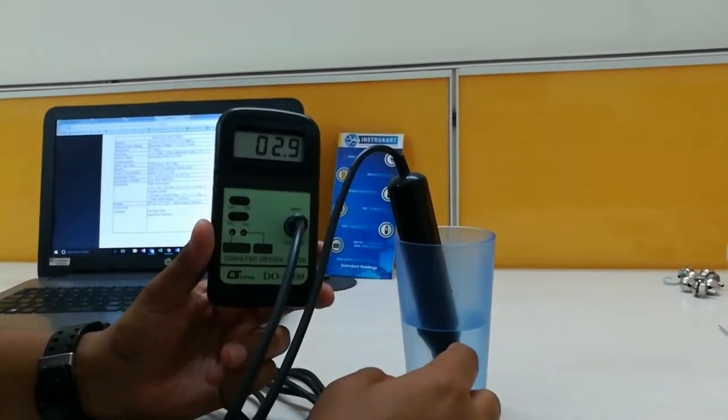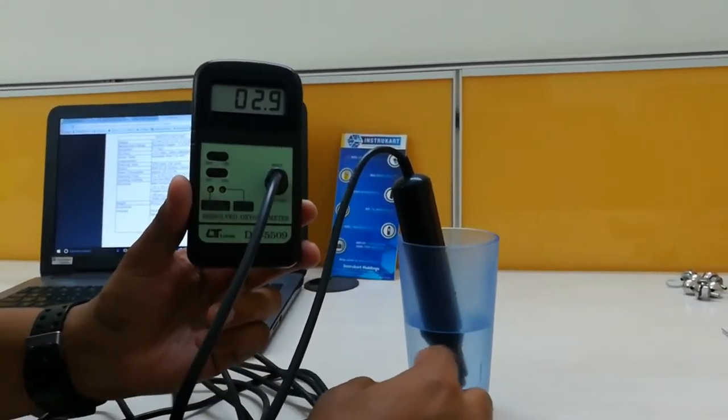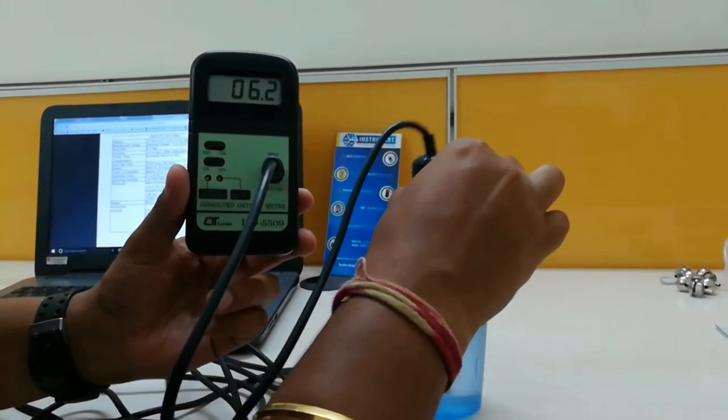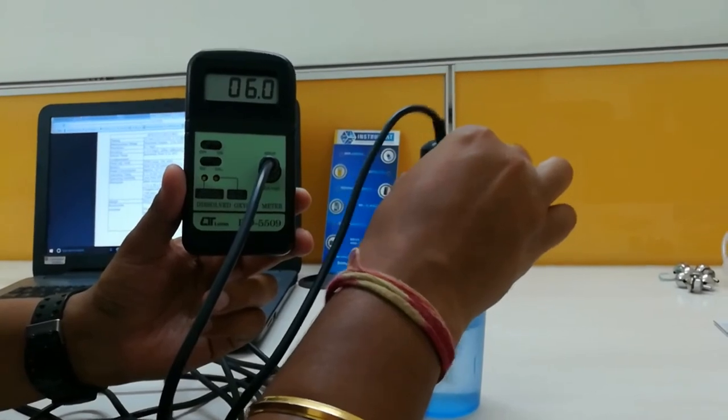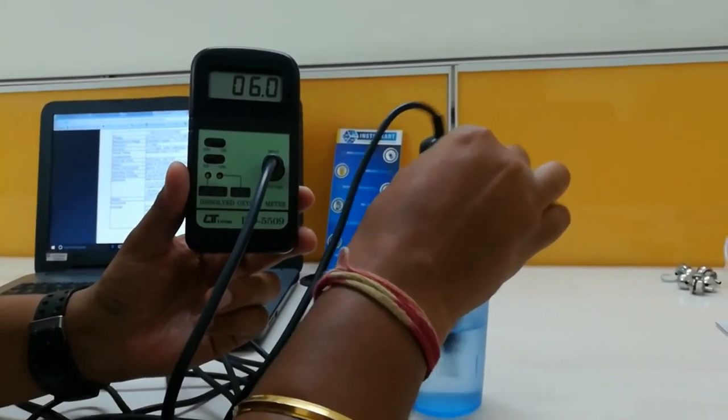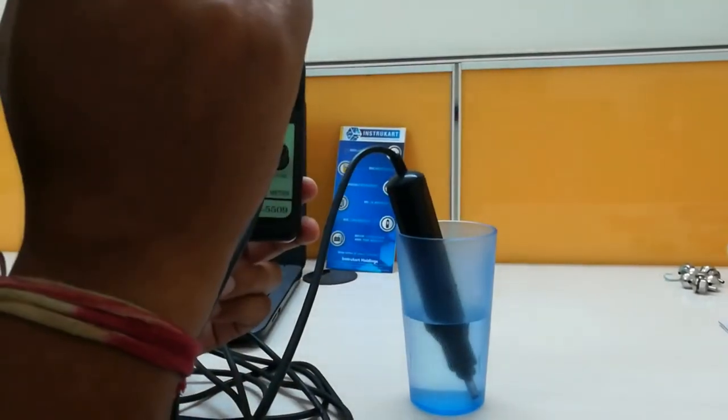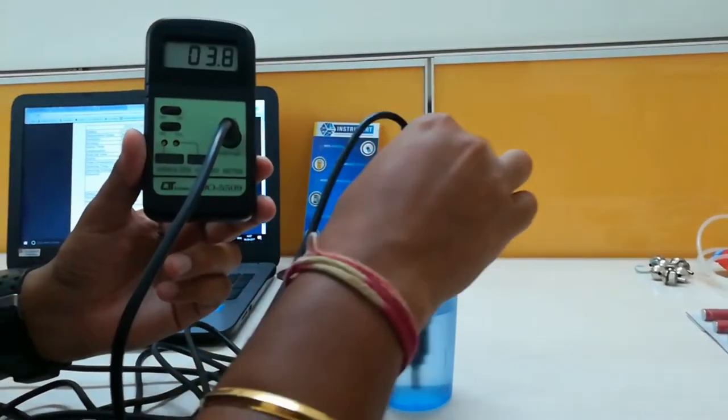If I try to add some more oxygen, it will increase. We'll simulate the same thing by shaking the probe. And we can see the increase of DO in that water.